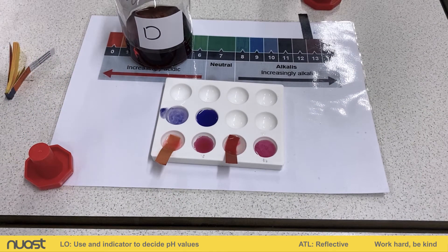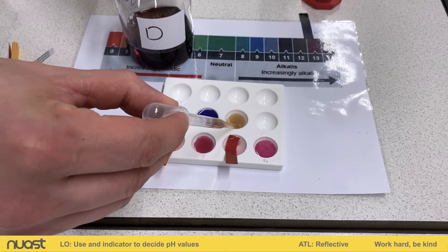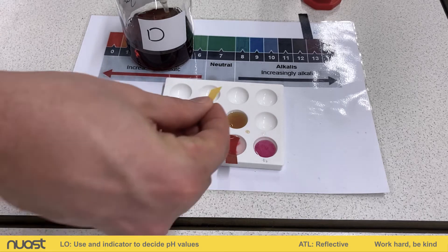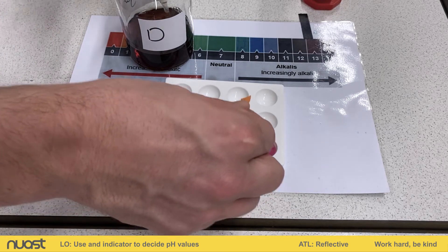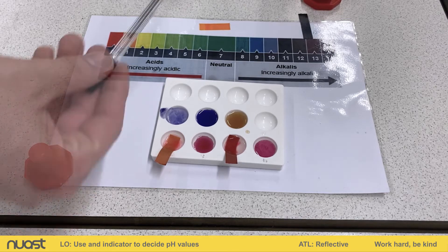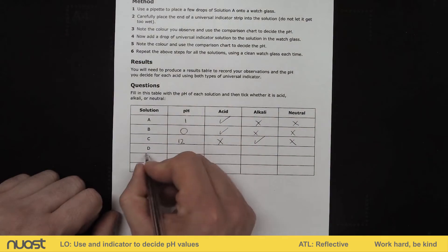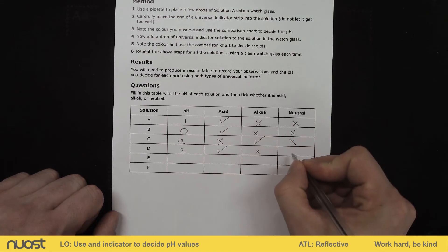We're moving on to solution D now. D is a coloured solution. This is where using a universal indicator solution could become problematic because you're mixing two solutions and mixing the colours. However, with the paper we'll see a clear colour change. Looking at the colour, this is an orange — lighter orange than our previous one. So I would put it somewhere between one and two. Solution D I'm going to say has a pH of two. Therefore it must be an acid — it can't be an alkali and it can't be neutral.